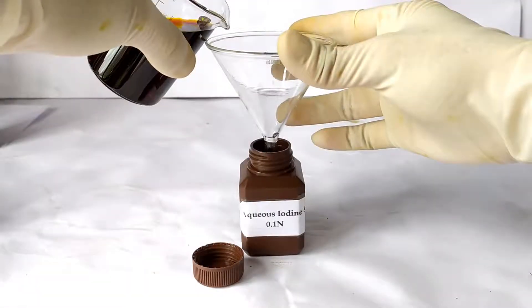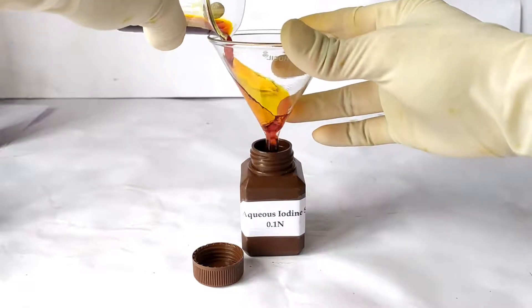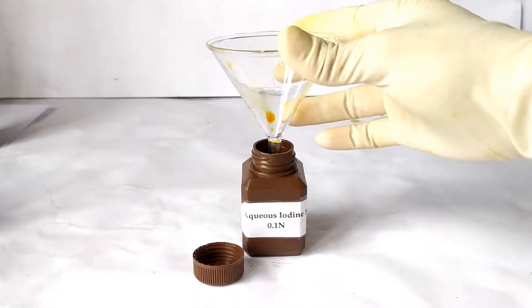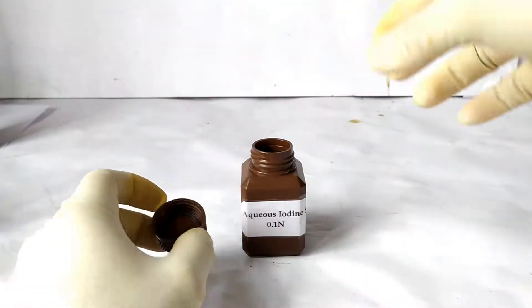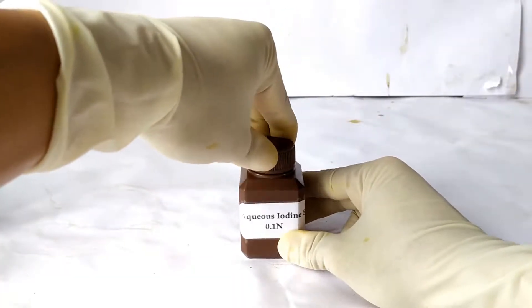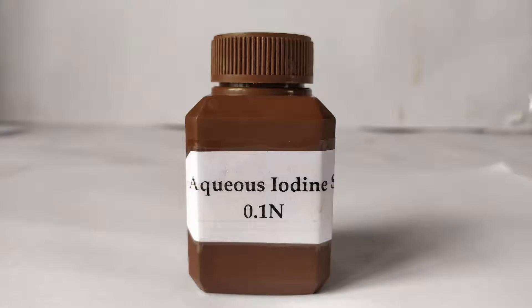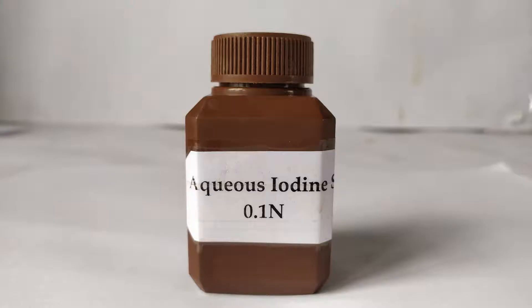Pour the solution into the appropriately labeled brown bottle and cap it tight. You can also wrap the bottle with aluminum foil to increase the shelf life of the solution. Store the bottle in a cool dark place to prevent the chemical degradation of iodine. The dilute 0.1 normal iodine solution is thus prepared and ready for use as a starch reagent.